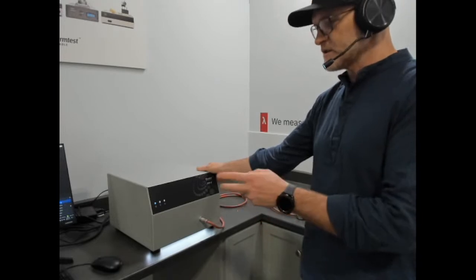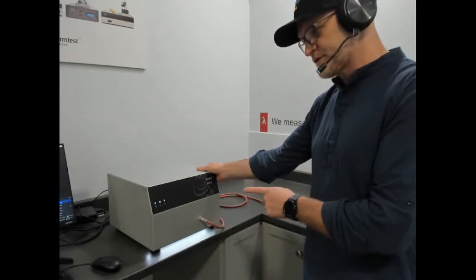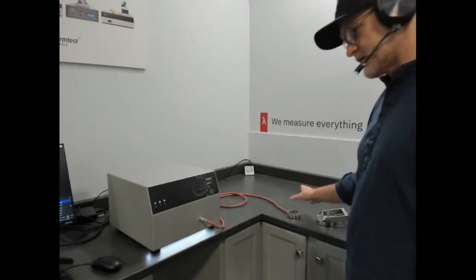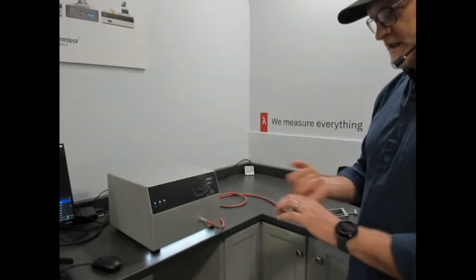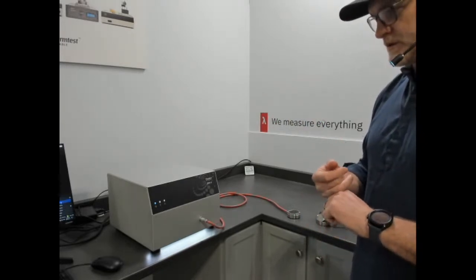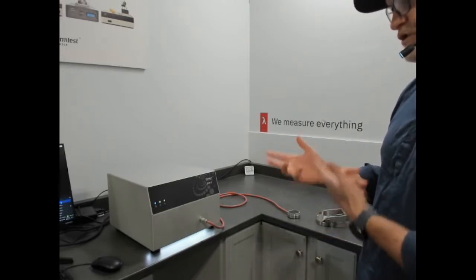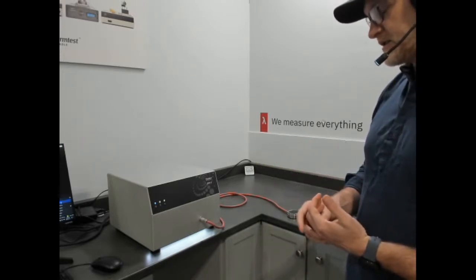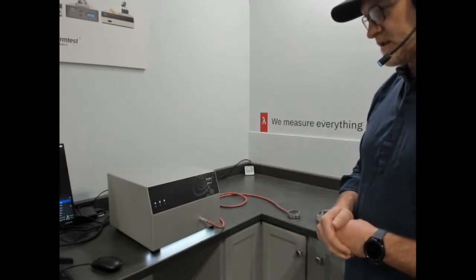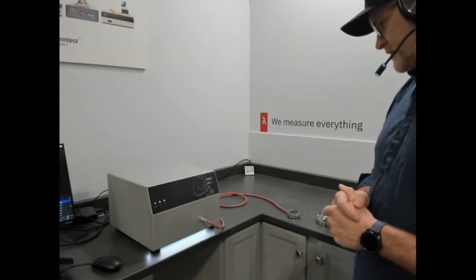That's the MPV. So the optional methods that you can add to it are an MTPS sensor, which I'll talk a little bit more about, the transient line source for ASTM 5334 and 5930, as well as a high temperature, high pressure THW sensor for basically testing liquids under pressure or temperature. So you can test approaching or past boiling points.